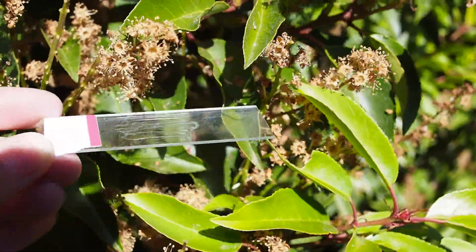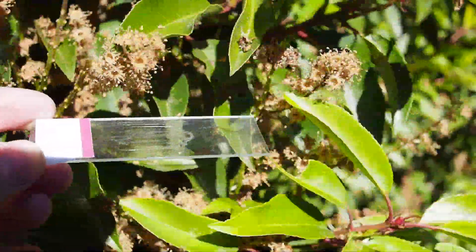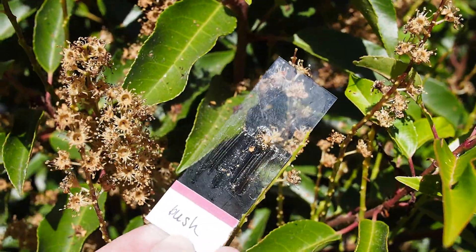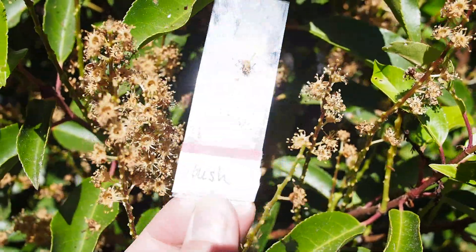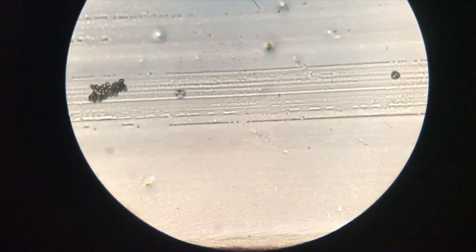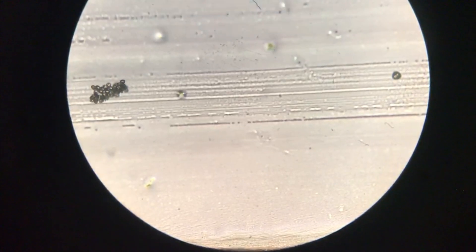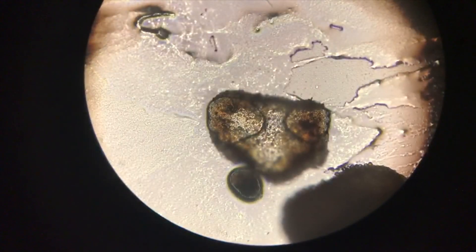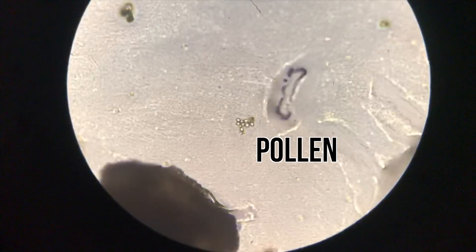Then we sampled one of the bushes growing in our backyard. Here you can see the slide from the bush under the microscope. You can see part of the plant as well as some of the pollen left behind when we shook the plant.